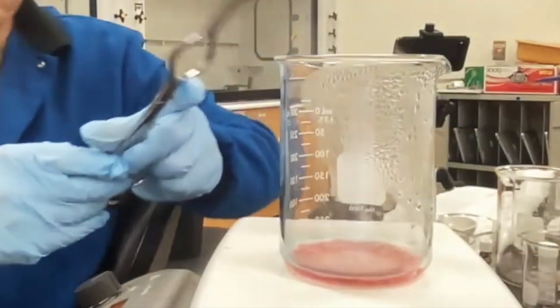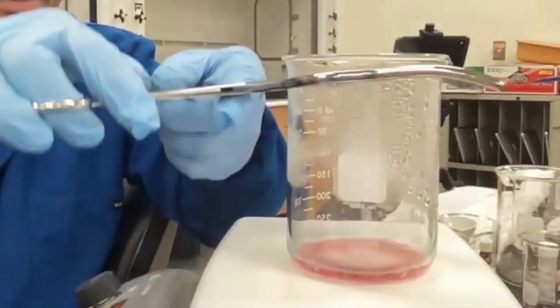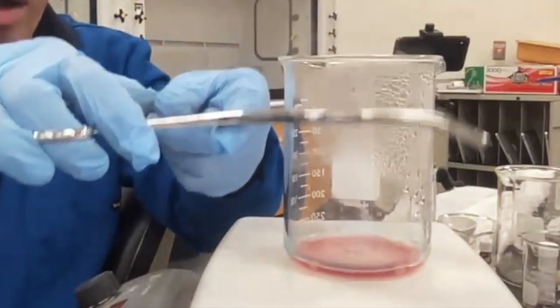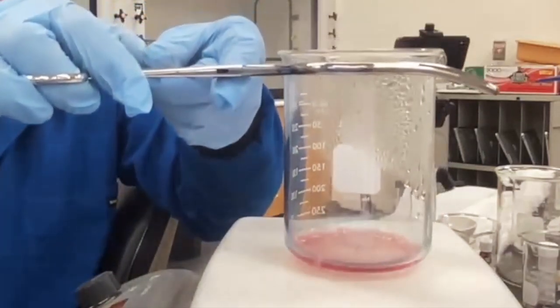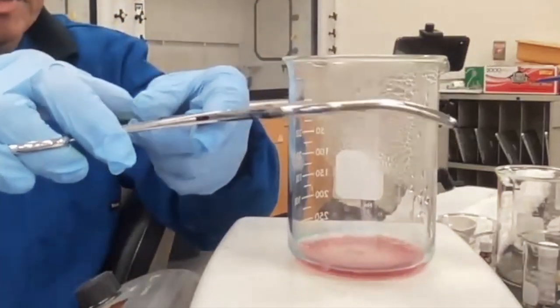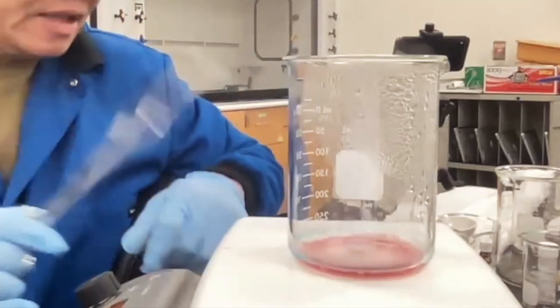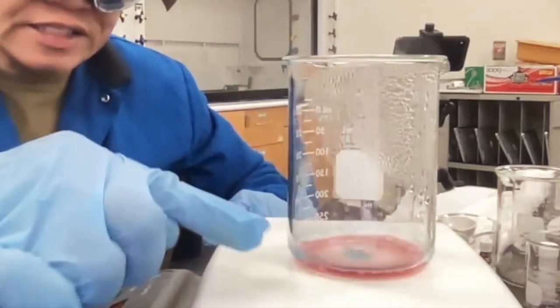Okay, so we're coming down to the last bit, and you really should be using tongs if you have them. Practice using them first so you don't pick things up and drop them, because I've seen a lot of students in lab try to pick it up with tongs this way, and then it just messes things up. They break the glassware, then they have to start the whole experiment over. Look at the center.